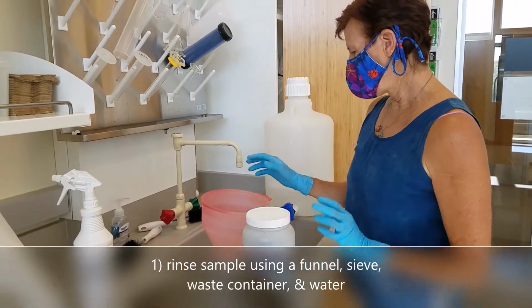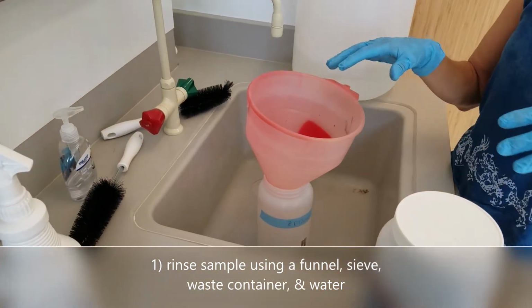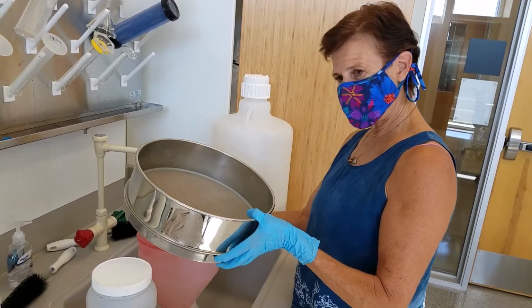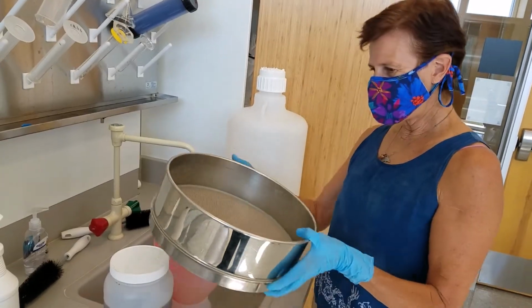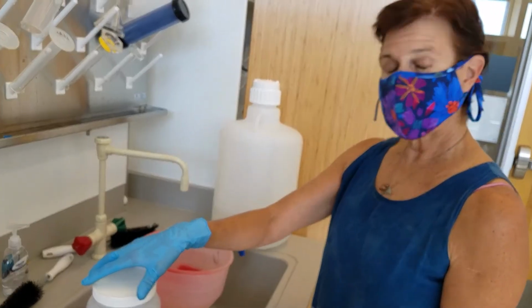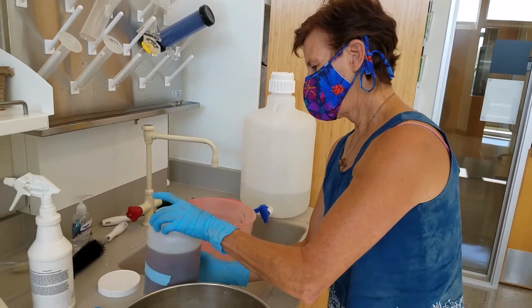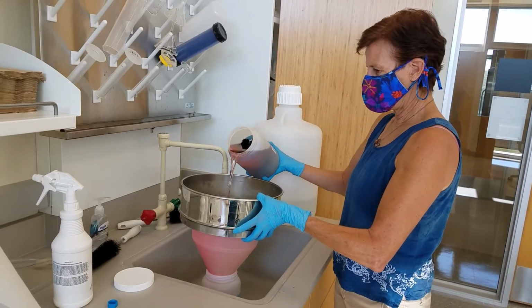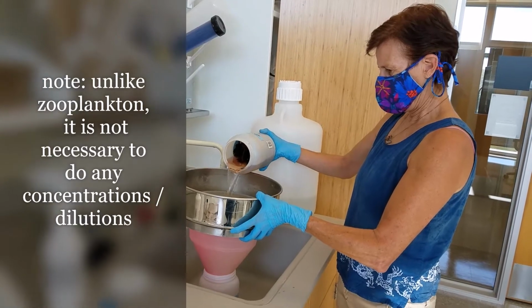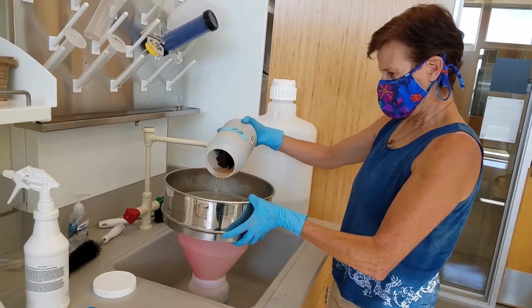We've got a waste container for the ethanol and a large funnel, and then we're going to be using a sieve. This is sort of a two-person operation since I've got such a big bottle. So we'll basically sieve it and rinse all the ethanol off, and then we'll put it into a smaller container.